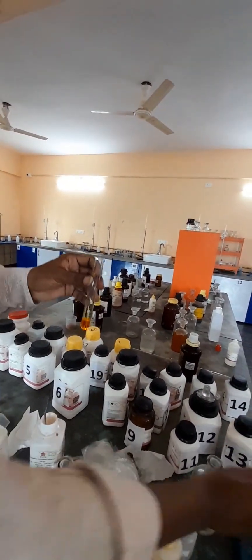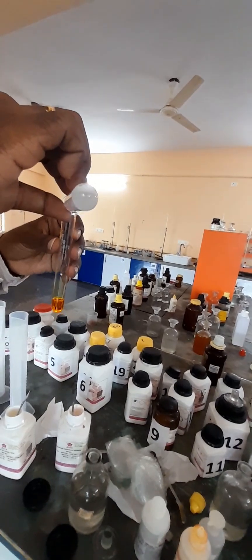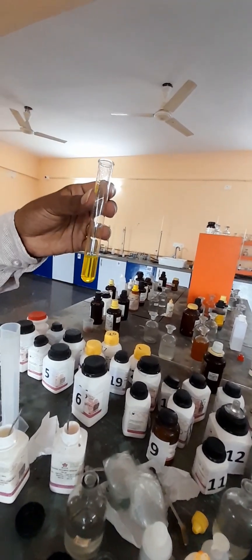Now, I am going to add NaOH solution here. If I add NaOH solution, what will happen? It develops yellow color.